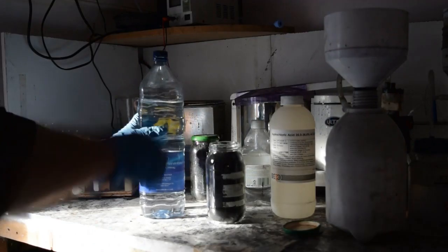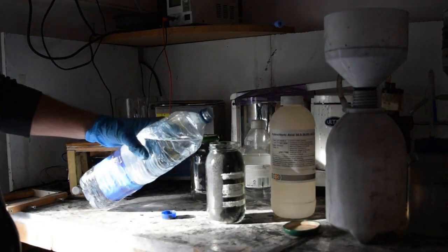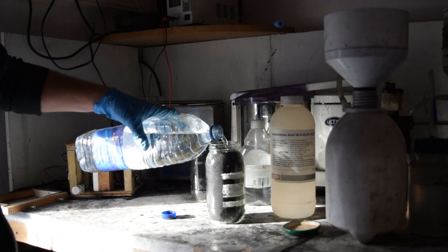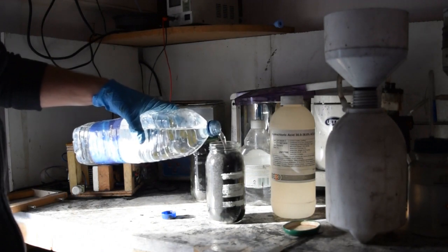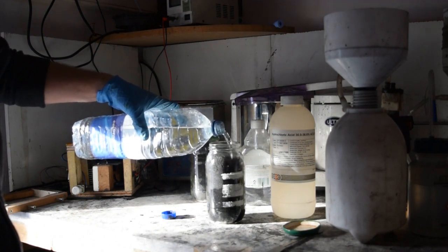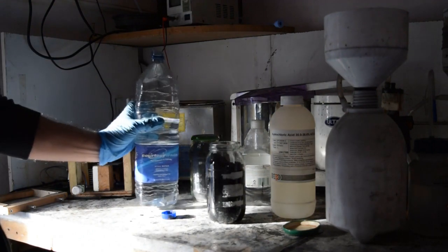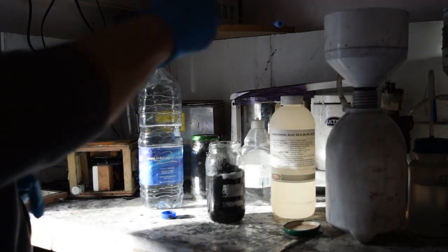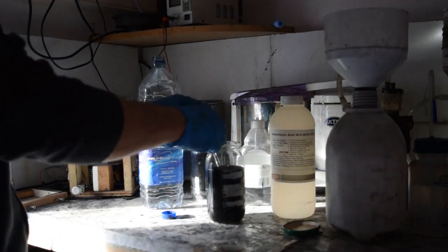It saves you having to buy lots of tubs of deionised water all the time. We pour in the deionised water, pour it in quite slowly because some of the carbon foam can become airborne if you pour it in too quickly. We'll fill this about two-thirds full and then we'll stir it all up, put it on my magnetic stirrer and then we'll add in the hydrochloric acid. Just got a glass rod here to wet all the carbon, make sure that all the carbon is wetted. Give it an initial stir with the glass rod.